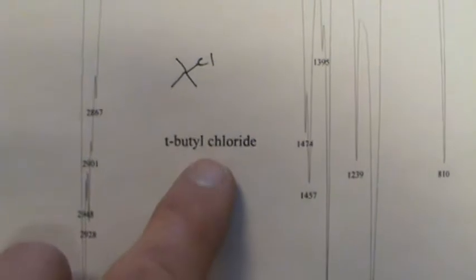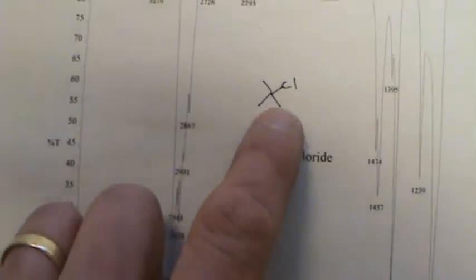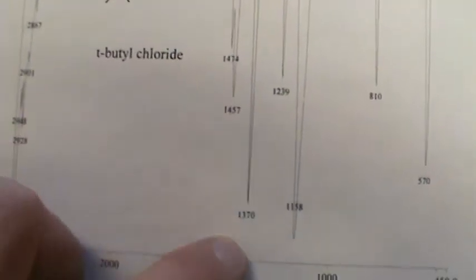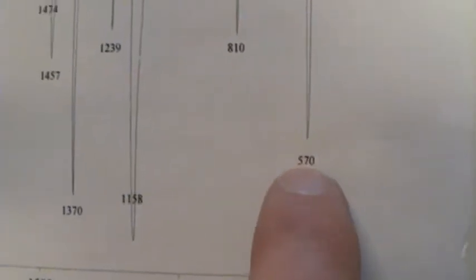So obviously t-butyl chloride, we'll start off with the alkane. These numbers right here are all this side of 3000, so all of this stuff is a CH stretch of an sp3. This stuff right here, because there's no aromatic ring, you could arguably say that's a CH bend, possibly that as well. You don't have to label that if you don't want to. So now this is what's interesting. Look at my scale. I went all the way down to 450 on that day. Most of your spectra, I've noticed lately, only go to 650. So see, this 570 peak would not be there for most of you.